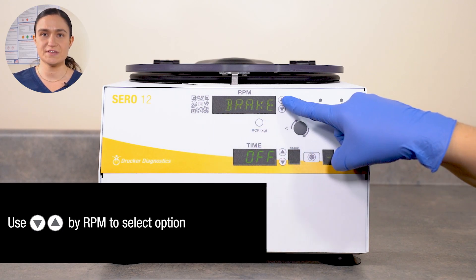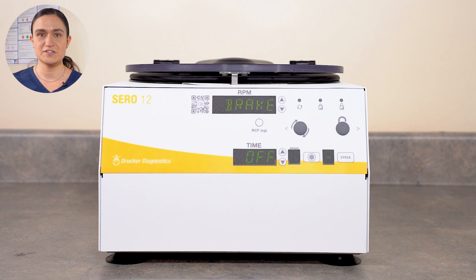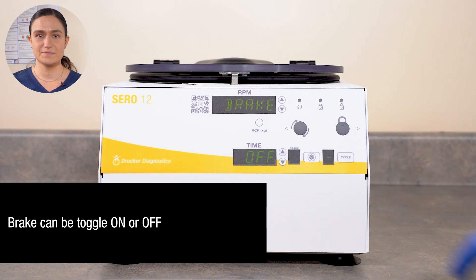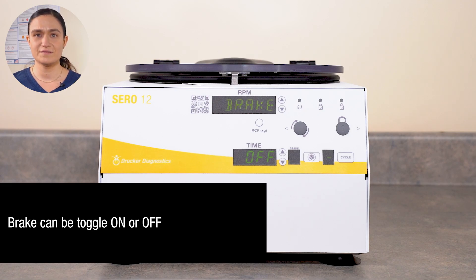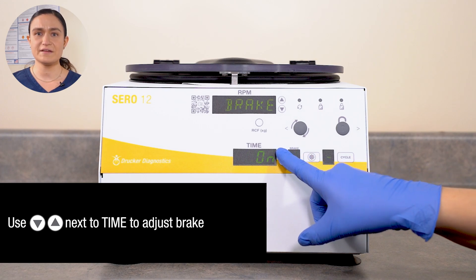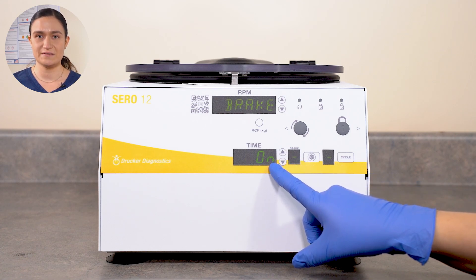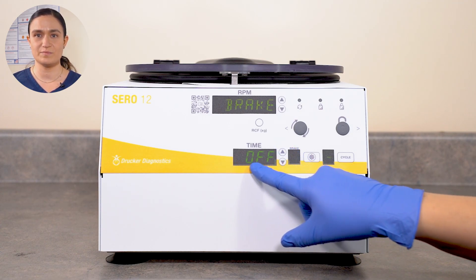From this screen, you can scroll through several menu options. We're going to start with the brake setting, which is the first setting shown when you enter this menu. The brake setting can be toggled on or off. On means braking will be applied when the centrifuge is decelerating. Off means no braking will be applied. Use the up and down arrow buttons next to the time screen to adjust the brake settings. On or off will be displayed in the time screen. The brake screen will show a dash if brake is on and will be blank if brake is off.